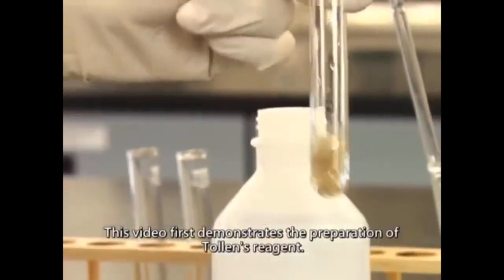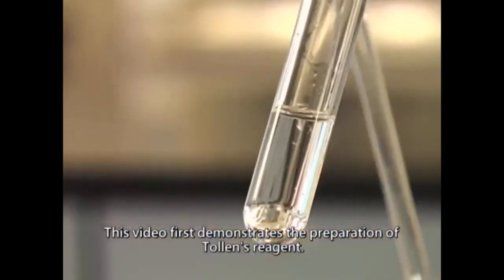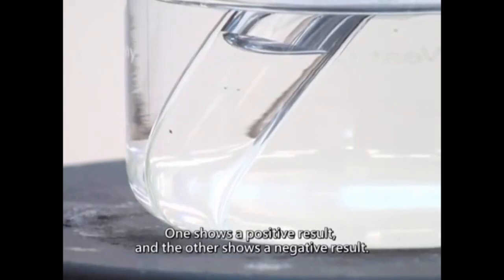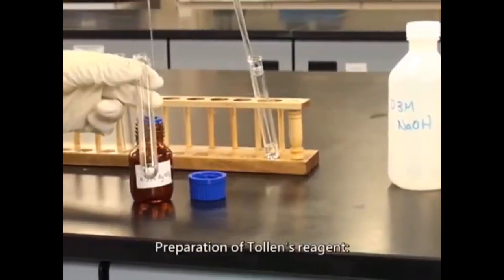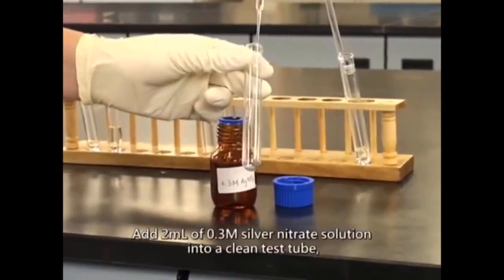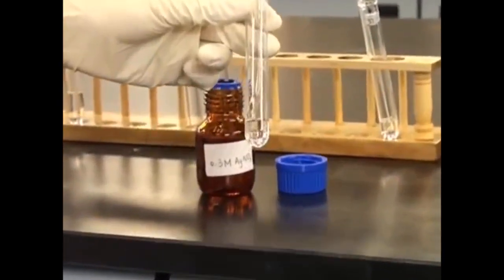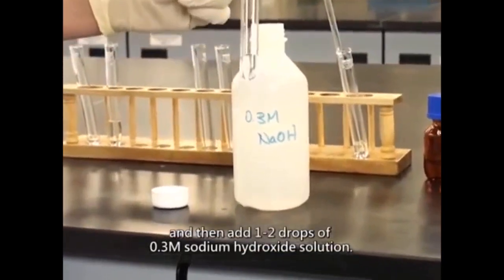This video first demonstrates the preparation of Tollen's reagent. Two tests will then be carried out. One shows a positive result, and the other shows a negative result. Preparation of Tollen's reagent. Add 2 ml of 0.3 molar silver nitrate solution into a clean test tube. And then add 1 to 2 drops of 0.3 molar sodium hydroxide solution.